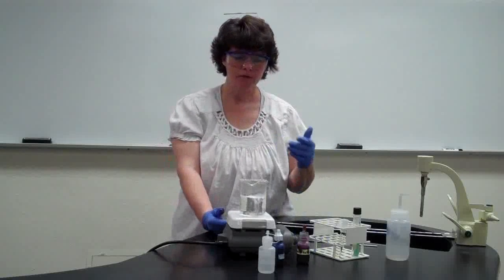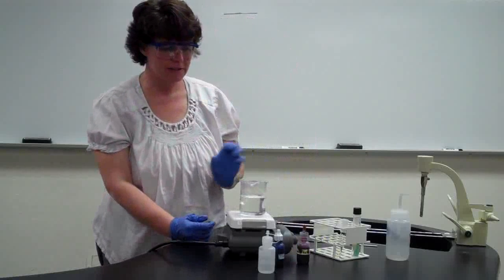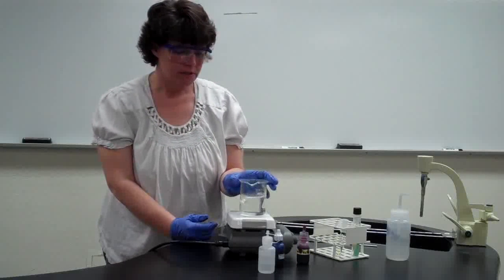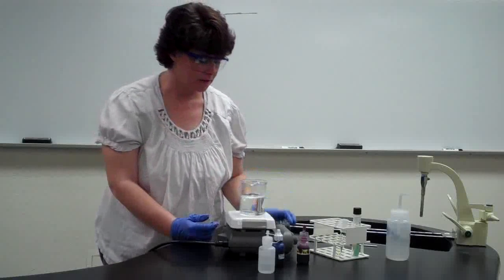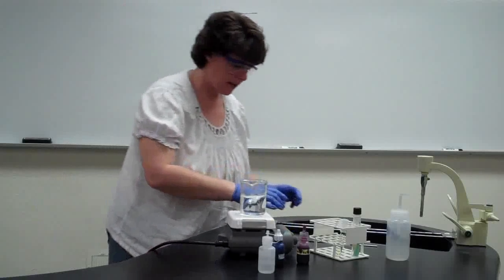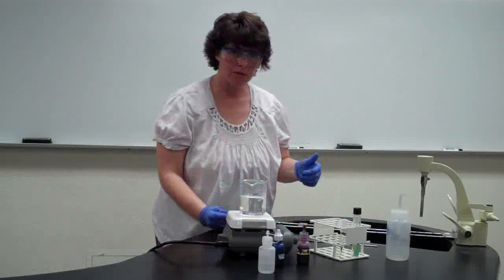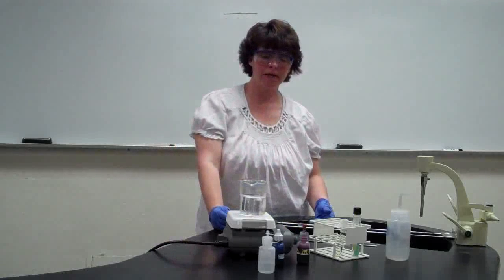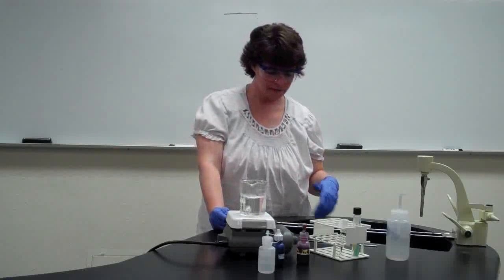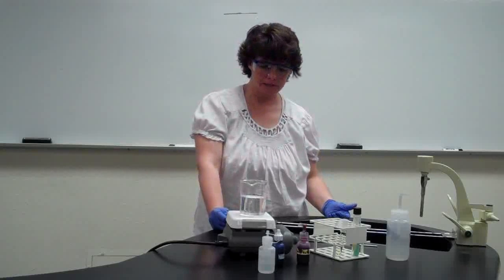So now we'll pretend that our 5 minutes has gone by, and now you want to take the slides off, of course, without burning yourselves. And you can do that by just grabbing the edges and putting them to the side. Okay? Now you're going to take it over to your staining tray. One of the things that we don't want to do is break the slide. And you're probably aware that if you put cold water on hot glass, that it's going to break the glass. So we're going to have to let that cool for a minute before we can start rinsing it.